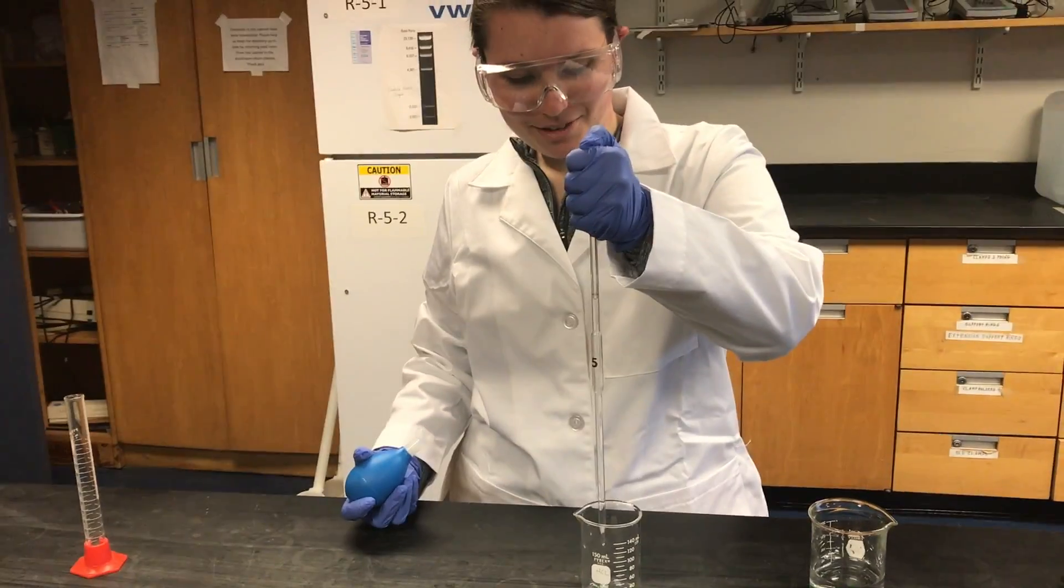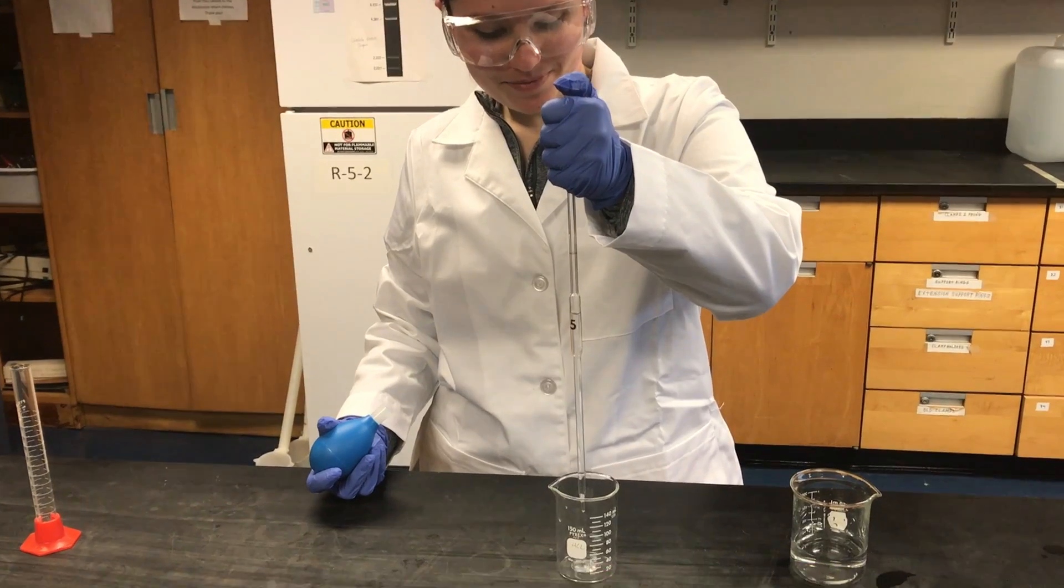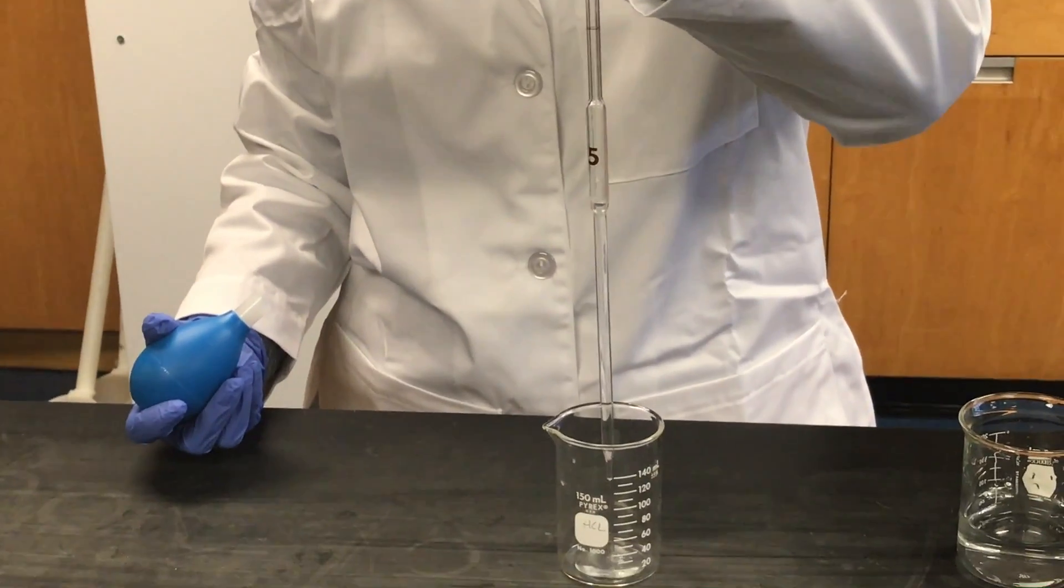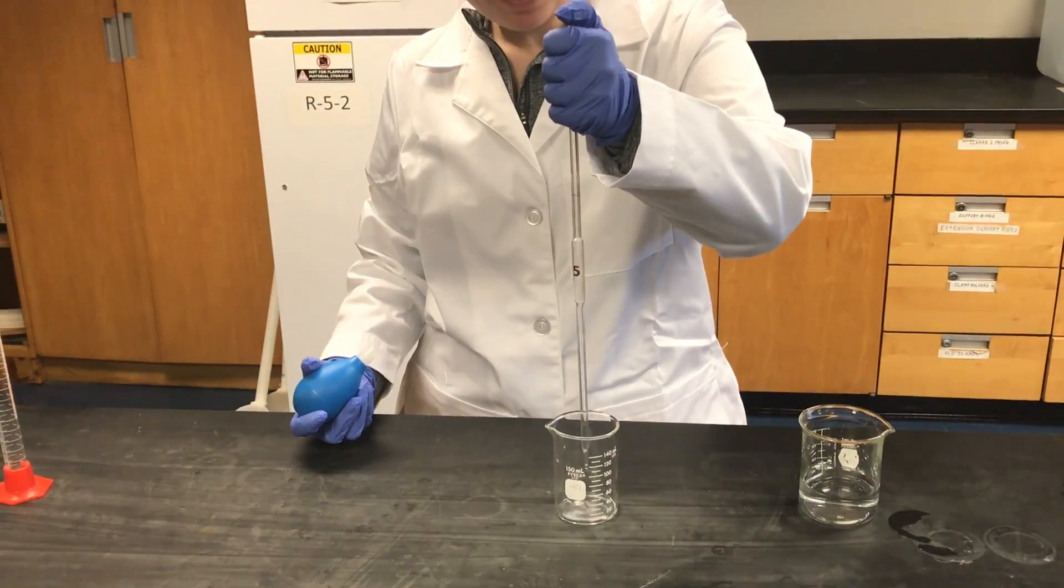To transfer the liquid into the desired glassware, make sure your thumb is tightly on the top and carefully release the liquid into the new glassware by releasing pressure from your thumb.